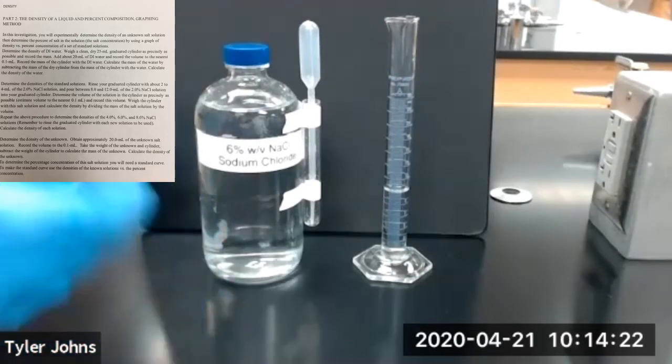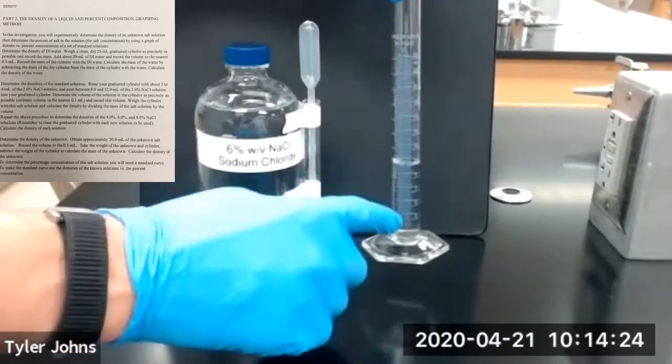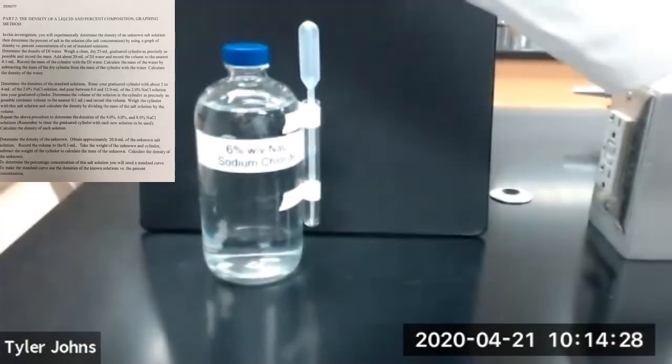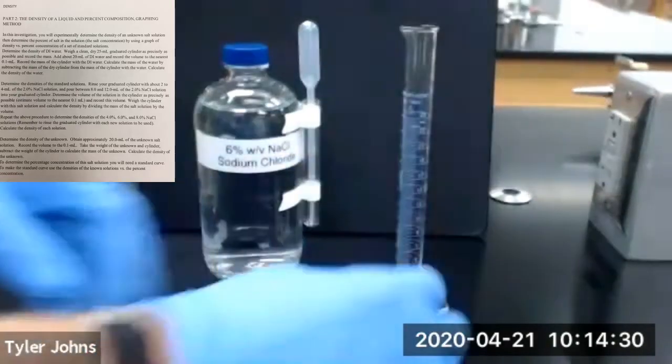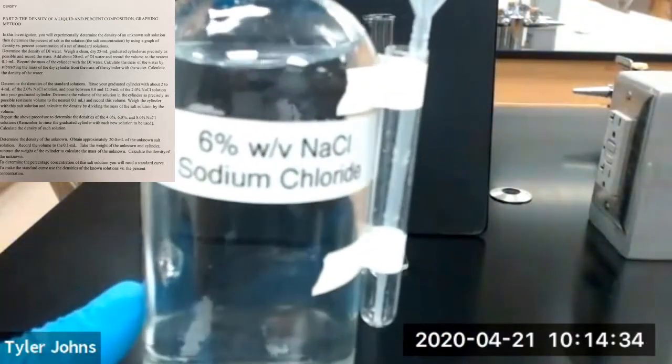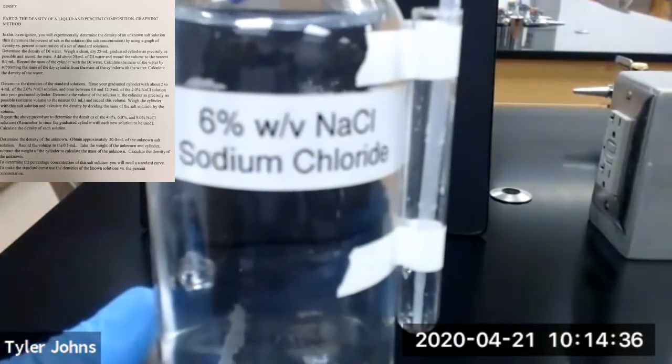Okay, so we're going to move on to our next standard salt solution. So we're going to dump our remaining 4%. Our next standard salt solution is 6% sodium chloride.